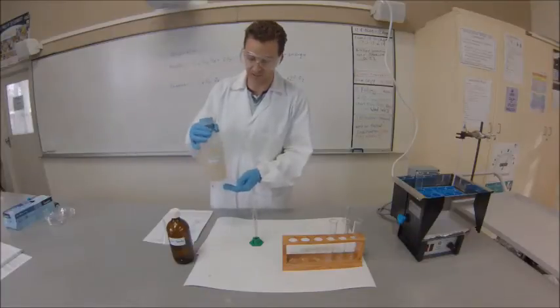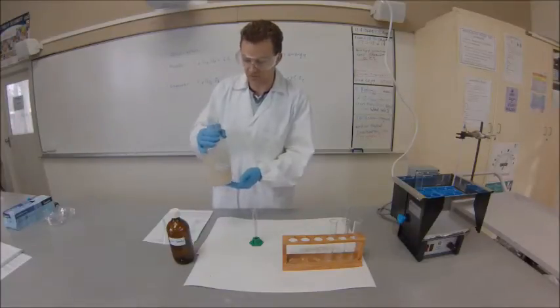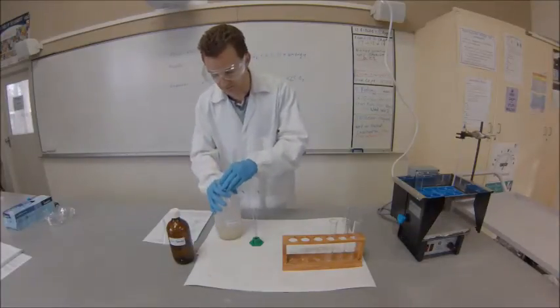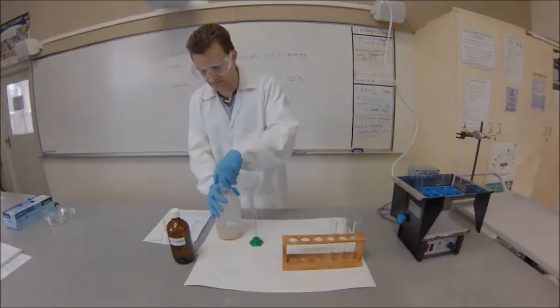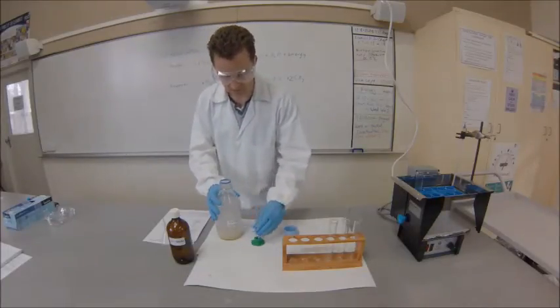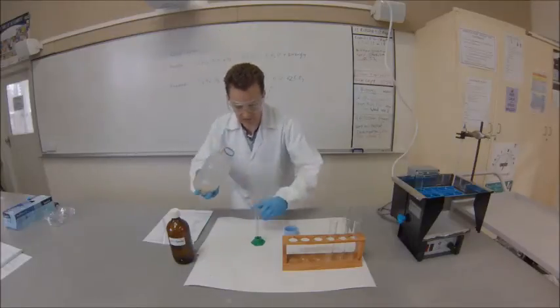With the yeast, again, this is particularly important - you have to agitate it as I mentioned before, because yeast settles to the bottom. Just as before, get to eye level.